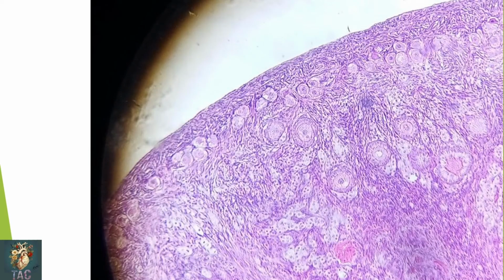So, a further higher magnification through the cortex of the ovary. First the germinal epithelium, then the tunica albuginea, and then the pool of the primordial follicles. Here you can see the primary follicles, the oocyte present in this primary follicle surrounded by the zona pellucida, and then the layer of follicular cells present over here. Again another primary follicle, another primary follicle, in different stages, and this may be the corpus luteum which is in stages of degeneration, and the connective tissue present in between these growing follicles.